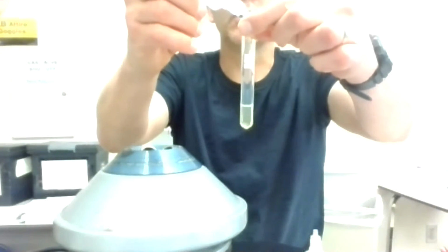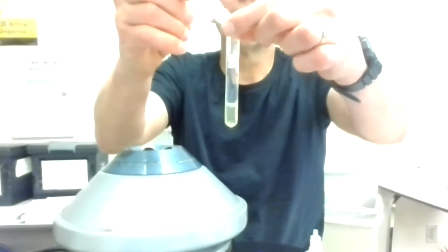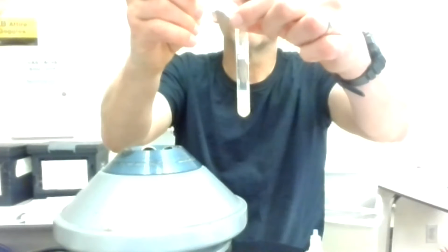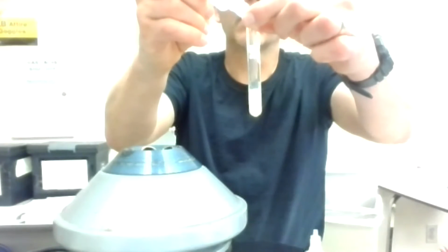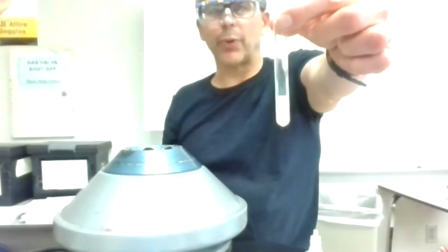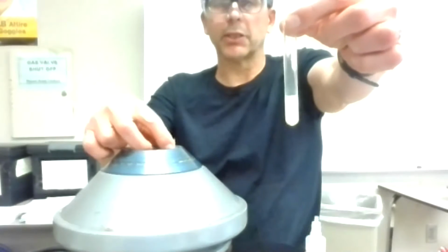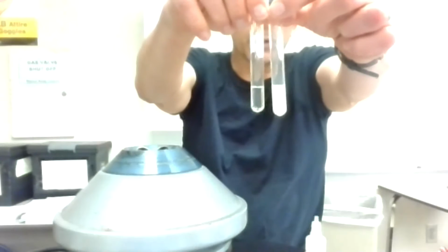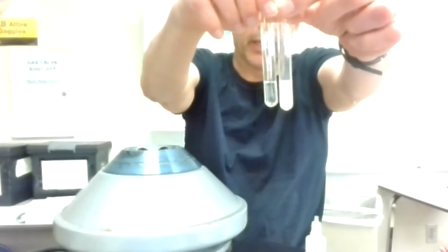Okay, so the third test I'm going to add is SO4 minus 2, and a couple extra drops with this one. This is the one that doesn't get real thick, but it clouds up after a little delay. This doesn't look like much delay here. It clouded up relatively quickly, maybe 3 or 4 drops to start getting cloudy.